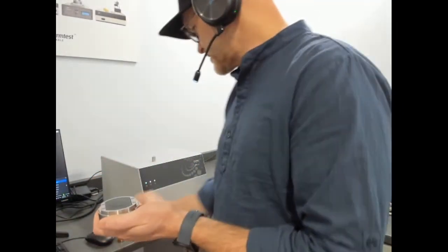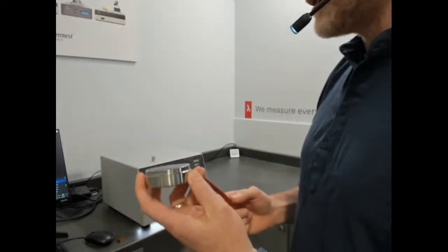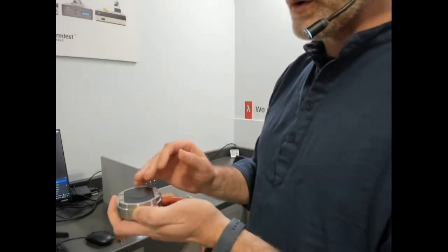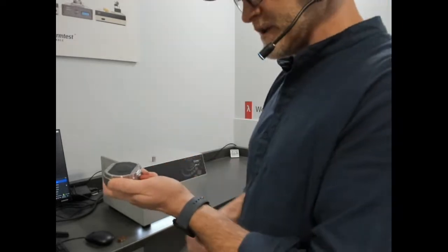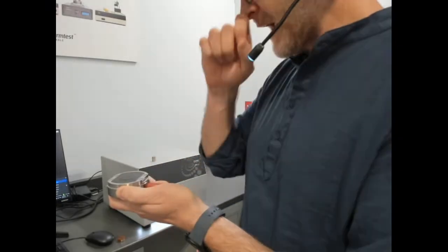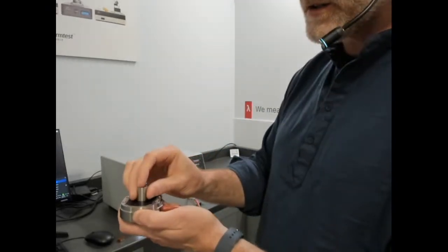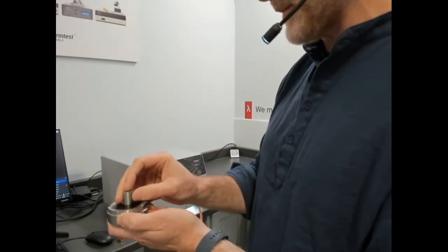So the MTPS sensor that is packaged as an optional sensor on the MPV has very unique capabilities. All of them are asymmetric. All of them are single-sided. And some of these are proprietary. So when you buy an MTPS sensor with the MPV, it has the built-in ability to measure slabs: asymmetric, single-sided, thin conductive sheets, one-dimensional, as we've described here, so one-dimensional thermal effusivity and thermal conductivity. That does require the input of specific heat.